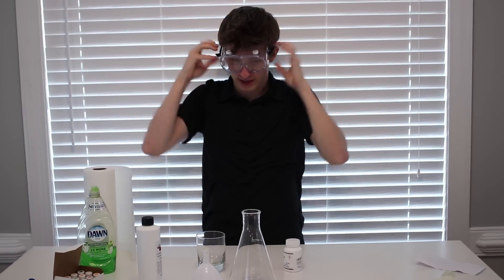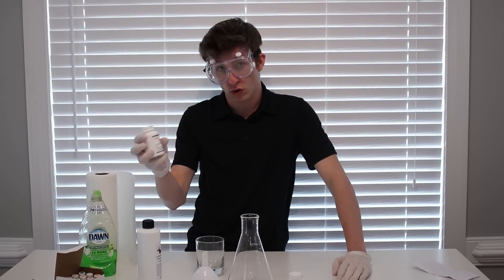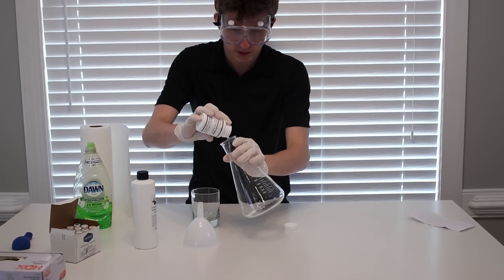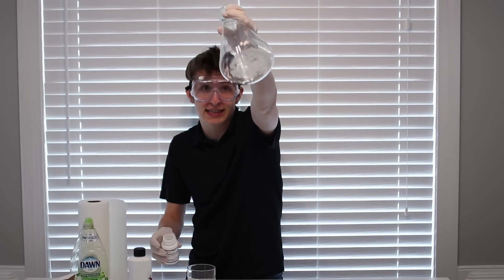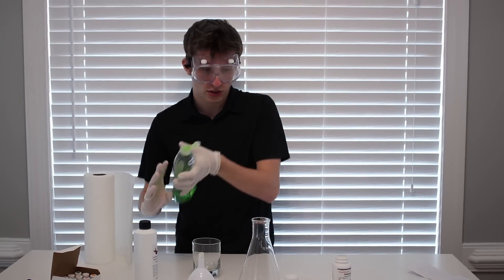That was way more painful than it should have been. All right, let's do this guys. So the first things first is we put the potassium iodide. I don't know exactly how much to do. This is all we have guys. So we might have to get more if you guys want to see more of this. For now, let's just put a little bit in, because honestly it's very, very little amount. We're not going to put that much in. So once we have that, let's go ahead and add some soap to it.